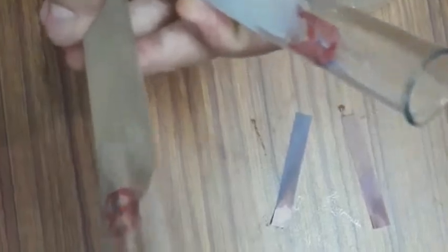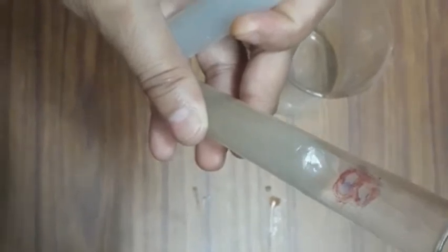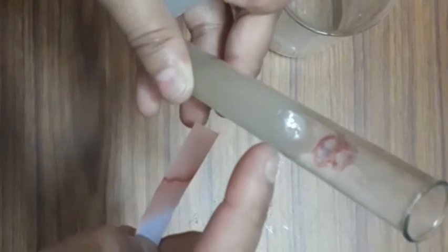So can you identify which one is the acid and which one is the base? In test tube A, the solution is converting red litmus paper into blue litmus paper, so it is a basic solution. In test tube B, the blue litmus paper turns red, so this is an acidic solution. So from this experiment, test tube A contains basic solution and test tube B contains acidic solution.